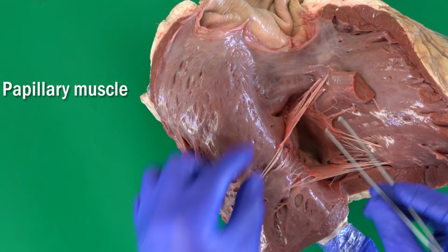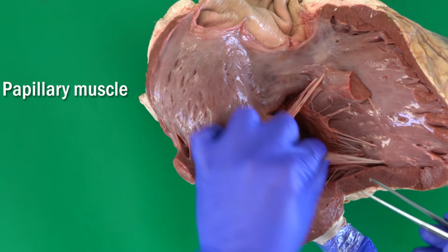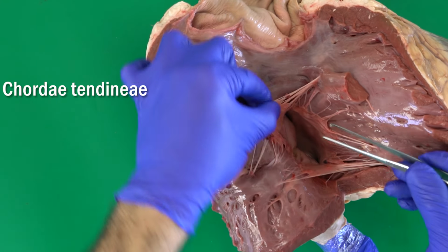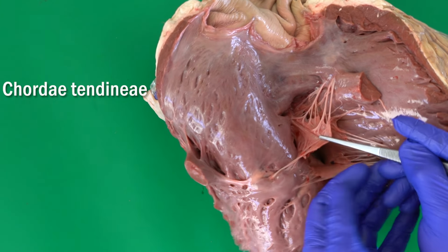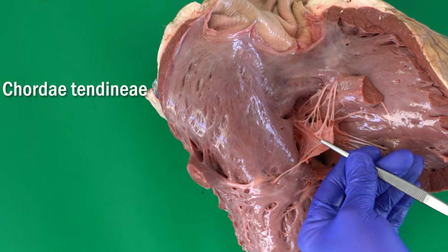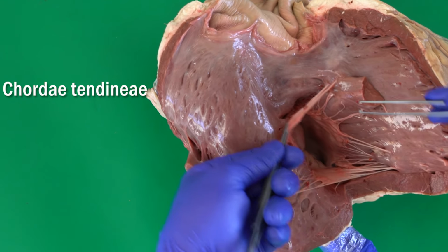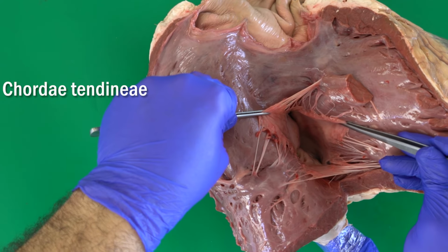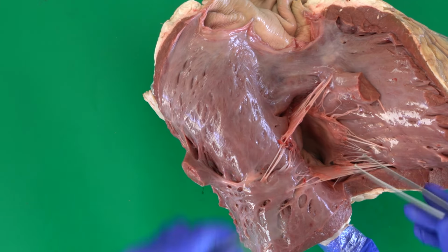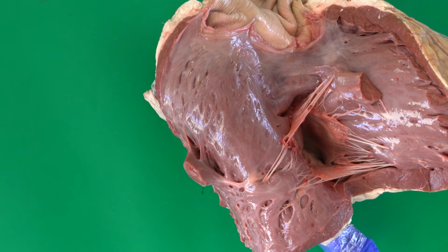This is the papillary muscle. The cusp is fixed to the papillary muscles by what's called the chorda tendineae. All of these tendons are called the chorda tendineae, and they fix the cusps to the wall of the right ventricle. So here we have the tricuspid valve.